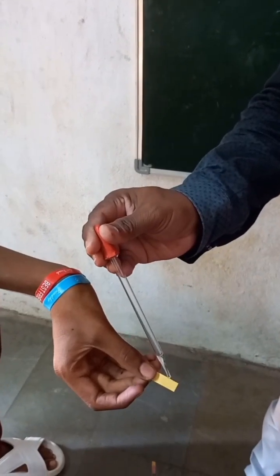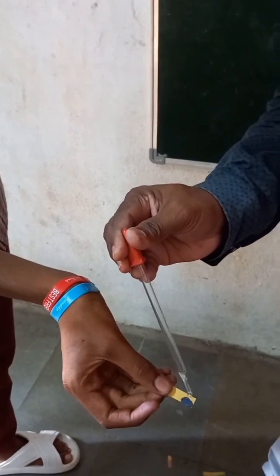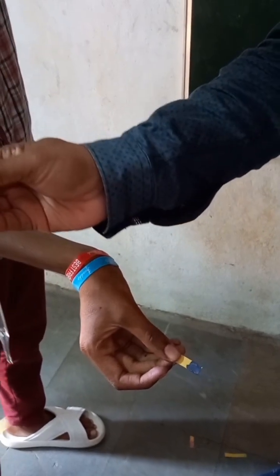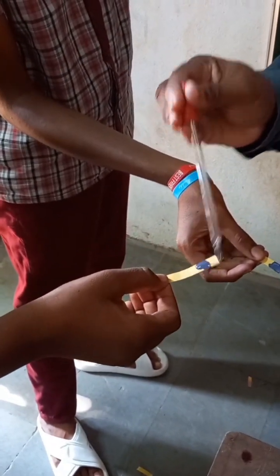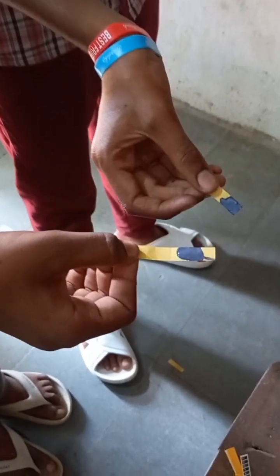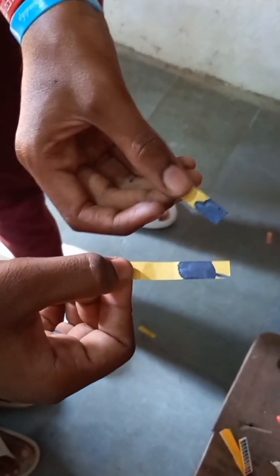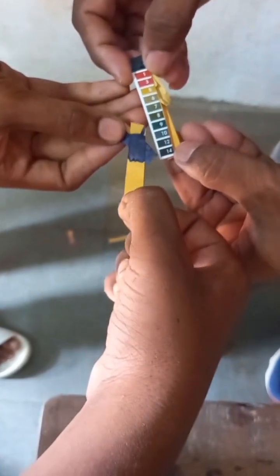Make some solution — whatever the solution may be. Blue color. What is its color? Blue color. What is its color? Blue color. Dark blue.